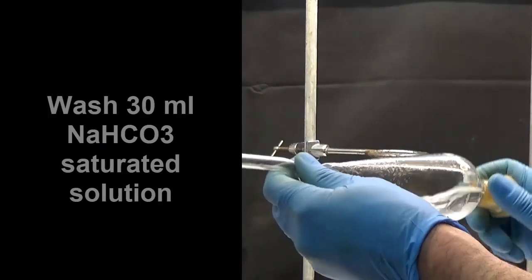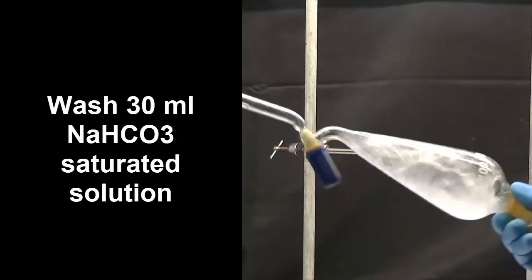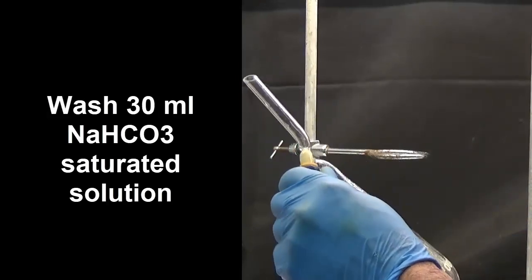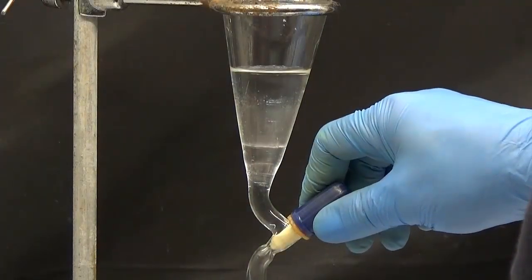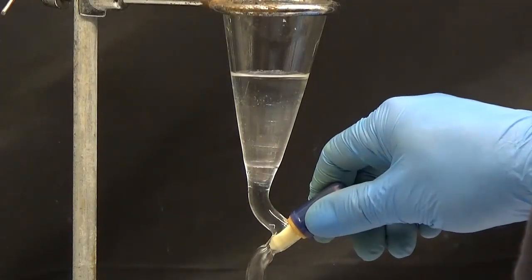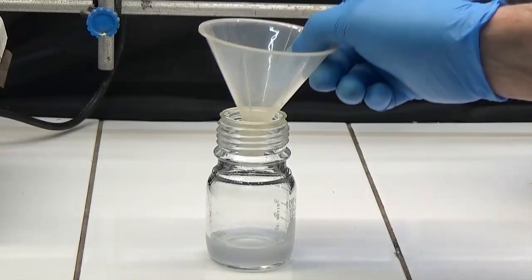Wash with 30 ml of saturated sodium hydrogen carbonate solution. Decant and dry with anhydrous magnesium sulfate.